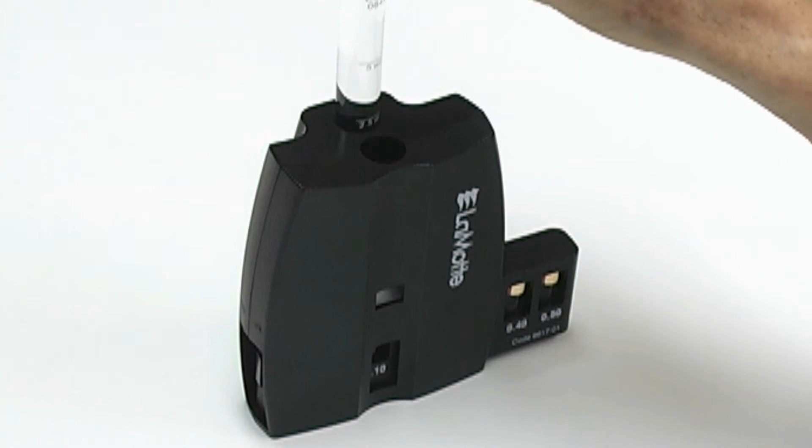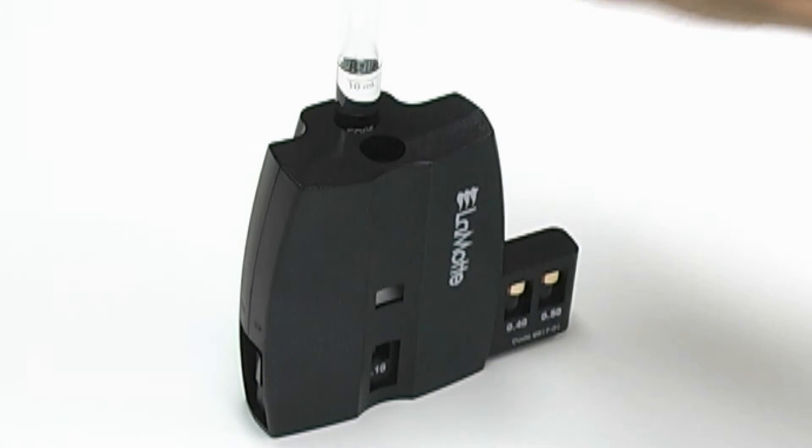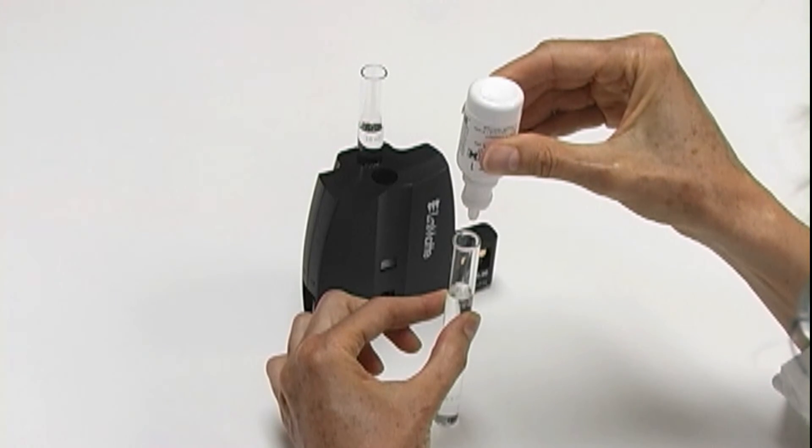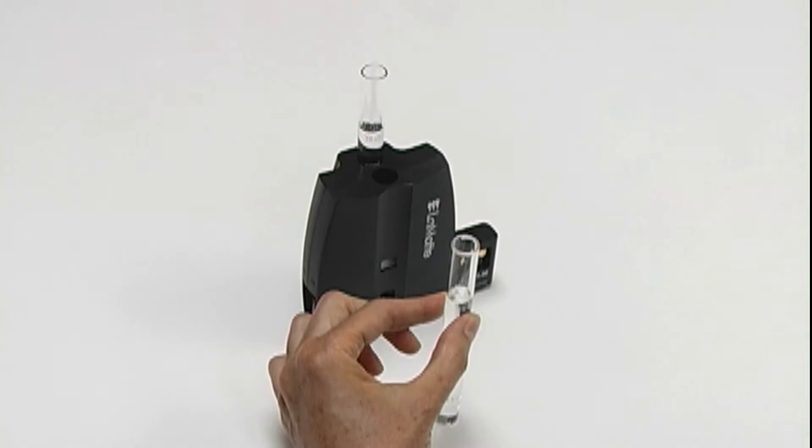Follow the instructions in the test kit to react the water sample with the reagent system.